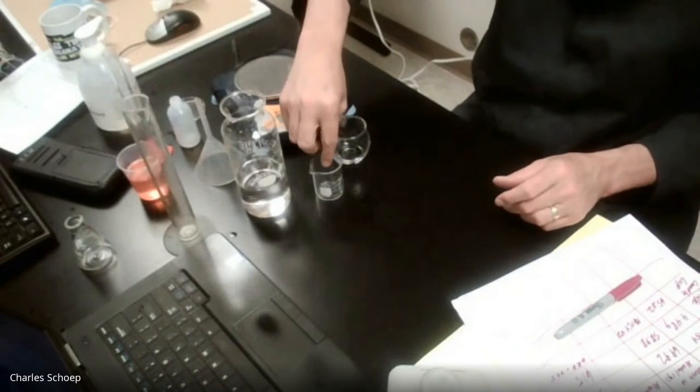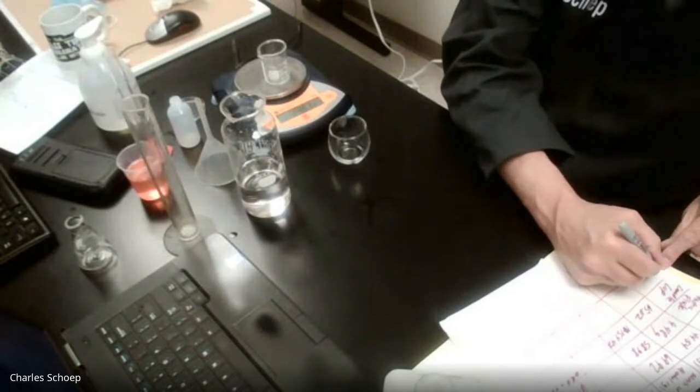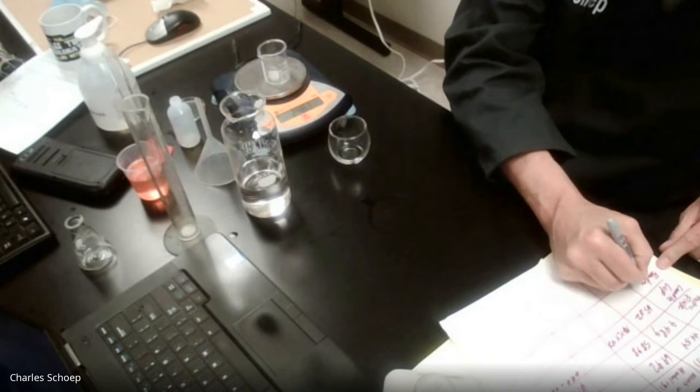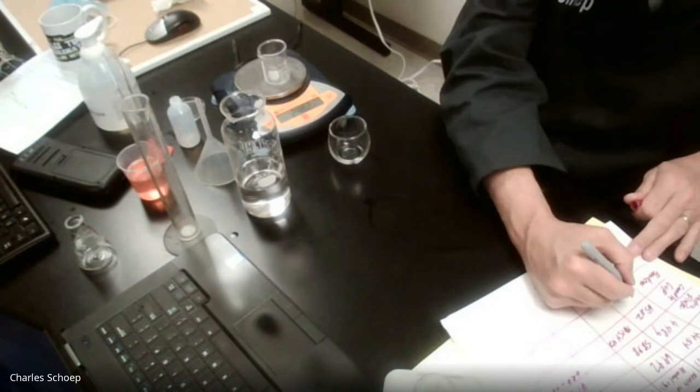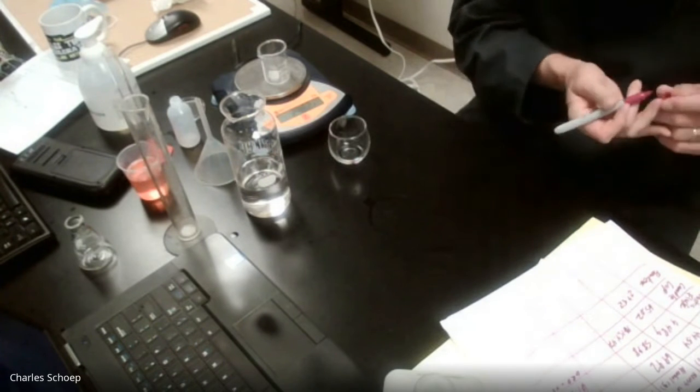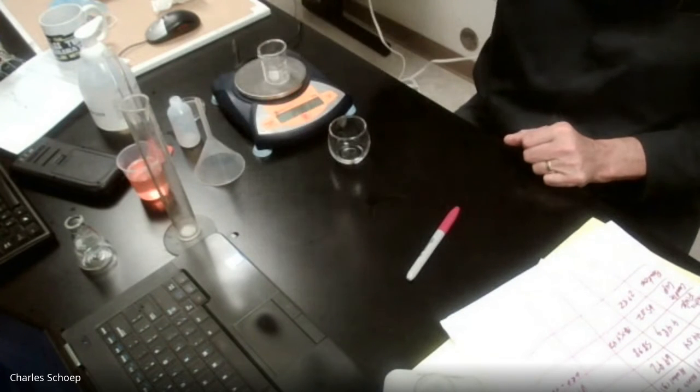And then finally, our last guy is our beaker. So we're going to do four guys. The last one is beaker, B-E-A-K-E-R. Beaker. All right, beaker weighs, remember I said last week, even though it's incorrect to say weight, it's just a term everybody uses, has a mass of 29.82.